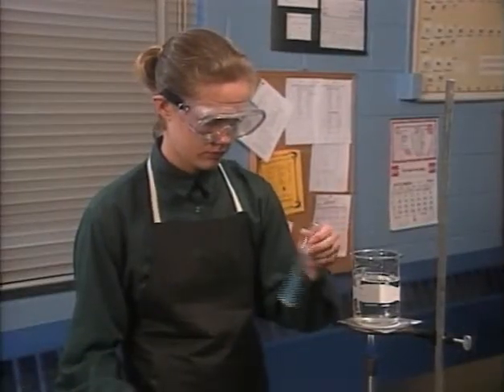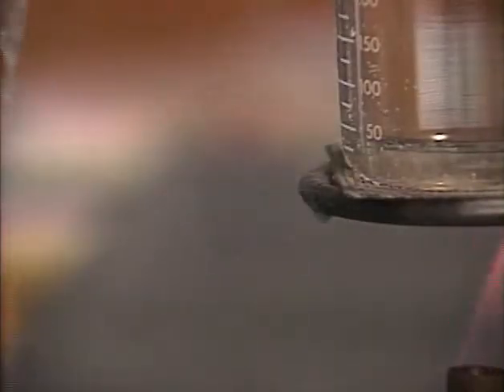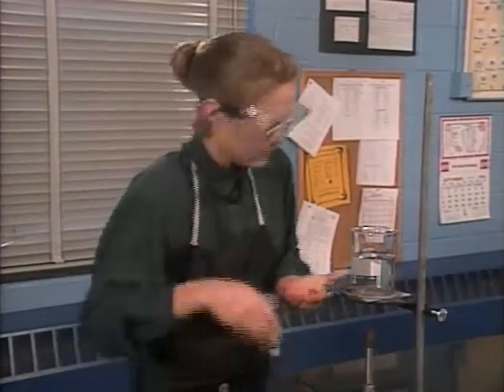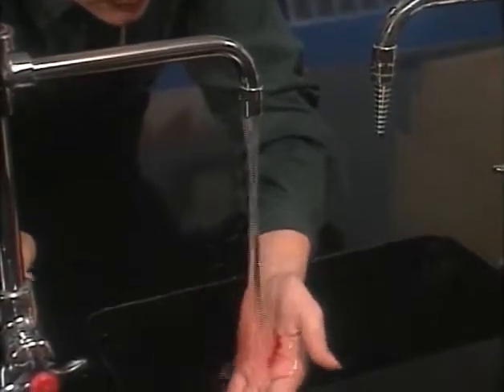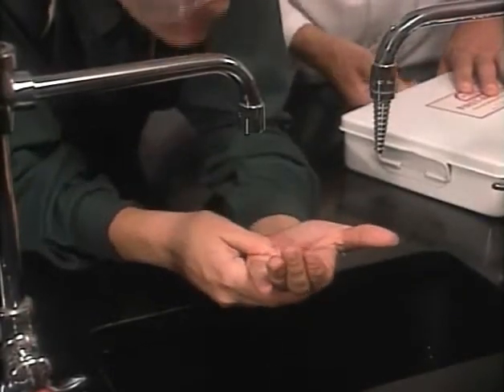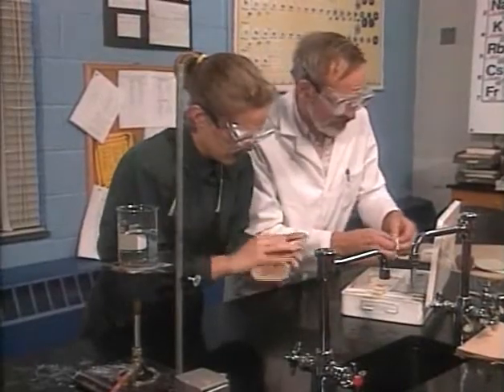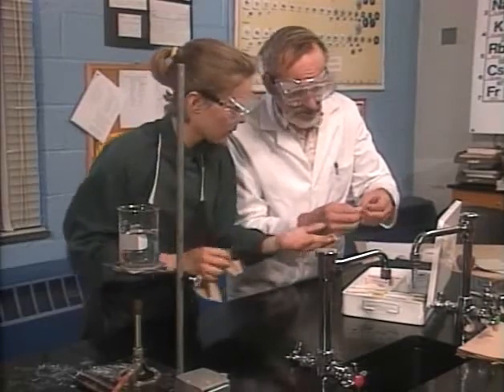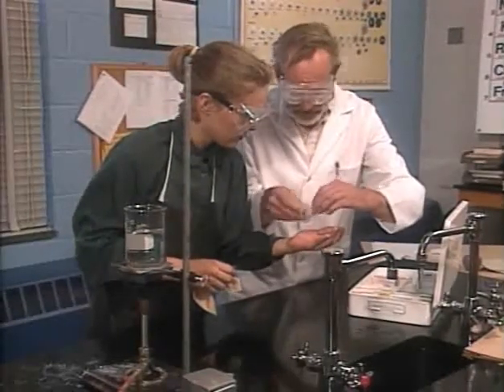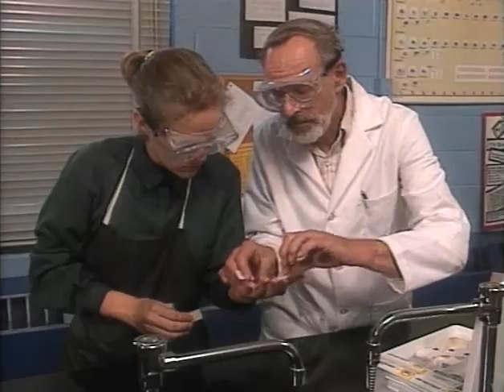In spite of safety precautions, accidents sometimes happen — that's why a well-equipped chemistry lab has emergency equipment. If you've cut yourself, wash the wound to remove any chemical traces and make sure there are no pieces of glass in the cut. Dry your skin carefully so a bandage will stick, then let your teacher put the bandage on. Notify your teacher whenever you have an accident, and make sure to get immediate medical attention after any injury in the lab.